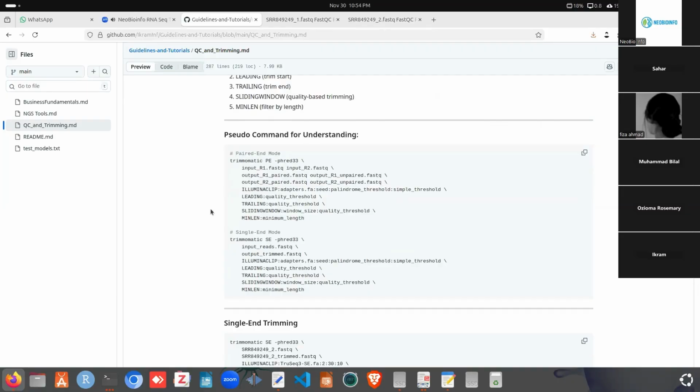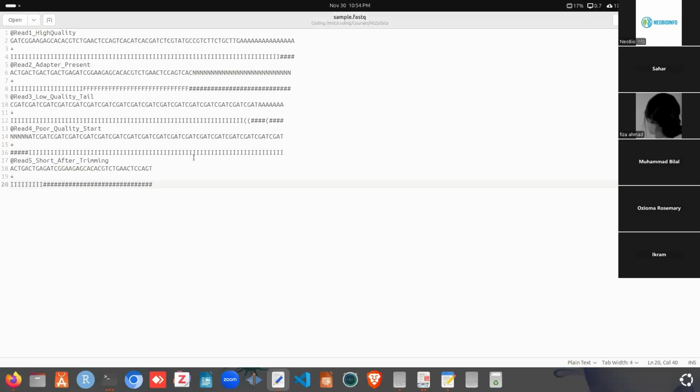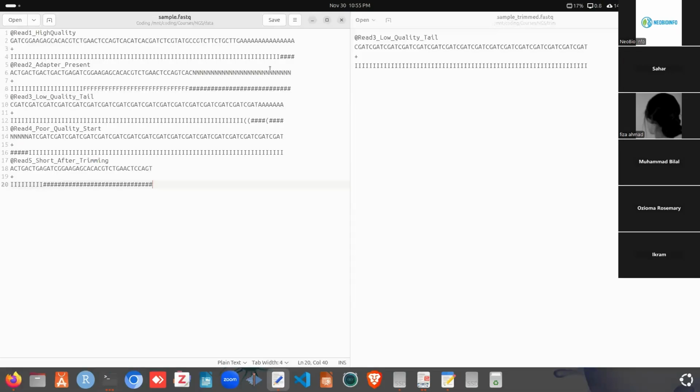When we do the analysis with a large file or large reads, it is actually hard to understand. So what we will do is perform the analysis on a single small-size read file, this one, and check how it actually happens. This is the sample.fastq file. I will first explain what it contains. It contains some poly-A tail here that has low quality, it contains the N contents here, also the poly-A tail. It contains low quality bases at first. Here we can see some low quality bases, and how we can trim that.